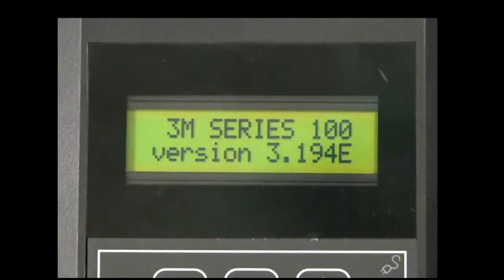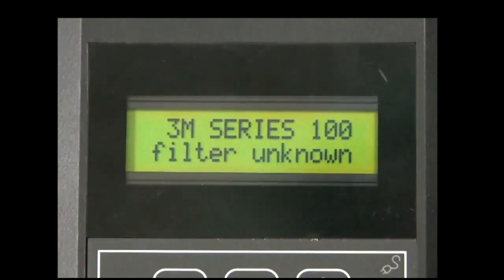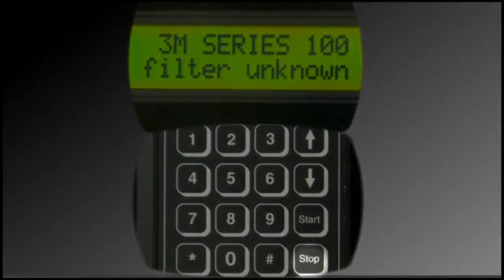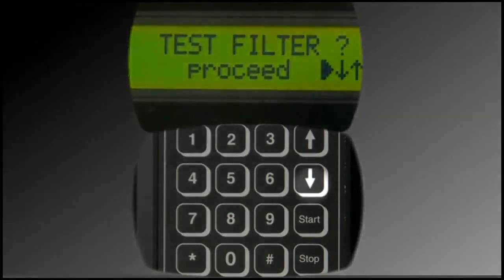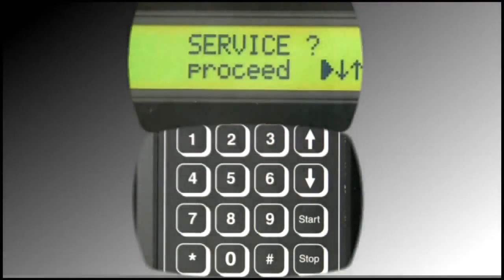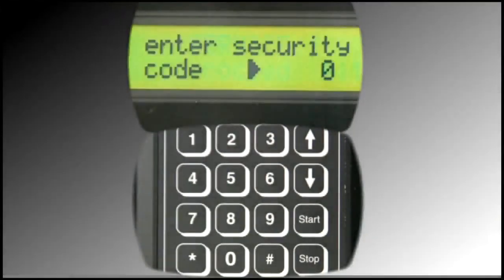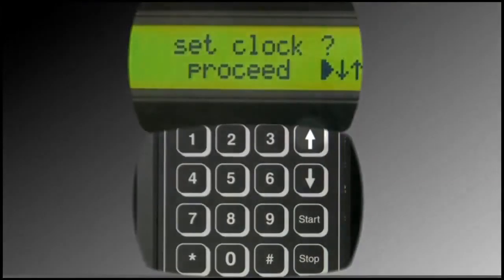A series of messages displays including the latest version information. It will then note the last test program used or display the message Filter Unknown. Press Stop on the device keypad, followed by the down arrow until Service displays on the screen. Press the pound icon. Press the 7 button. Press the up arrow 2 times.